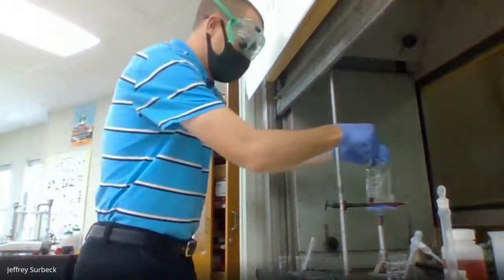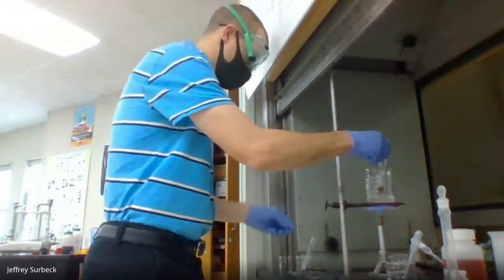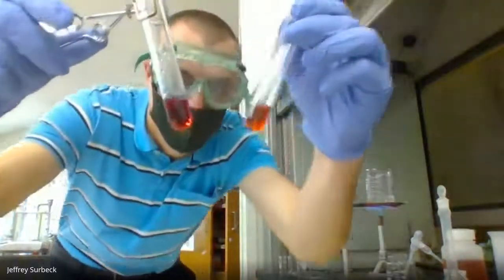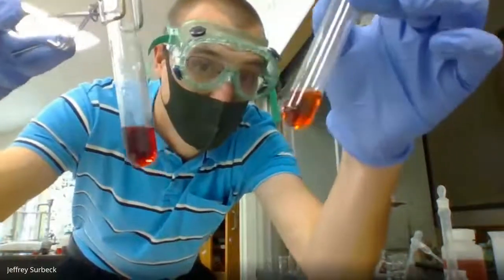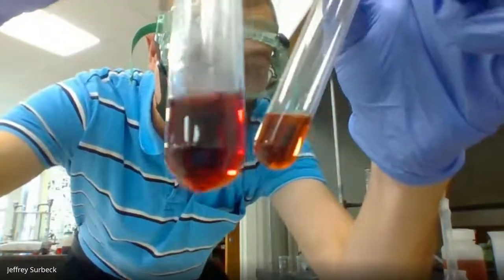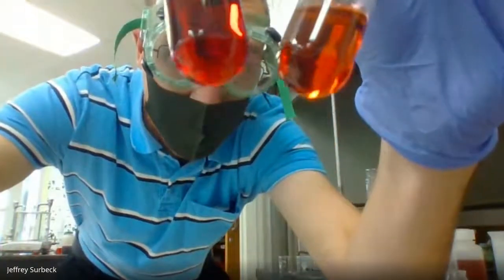Okay, color looks pretty good here. I will check it and compare. Oh yeah, all right. So check this out. The one in my left hand that I have without a test tube holder, that is the cool cobalt chloride. And check out the color difference with this heated cobalt chloride. You can definitely tell that there is a difference.